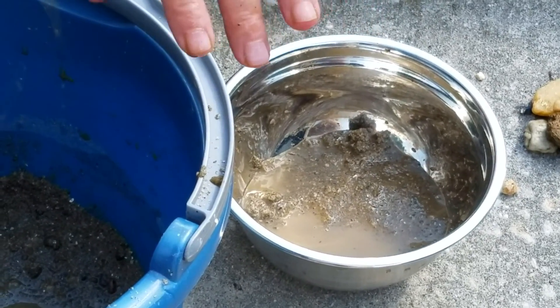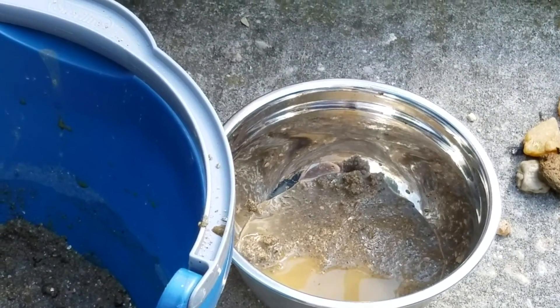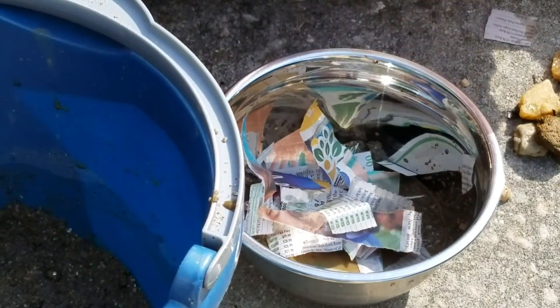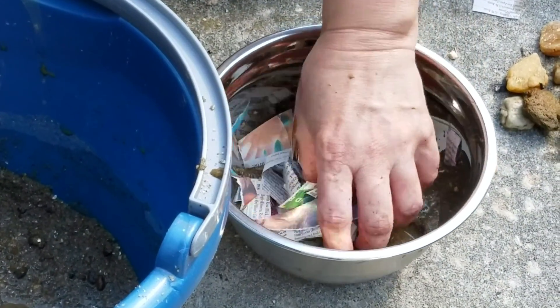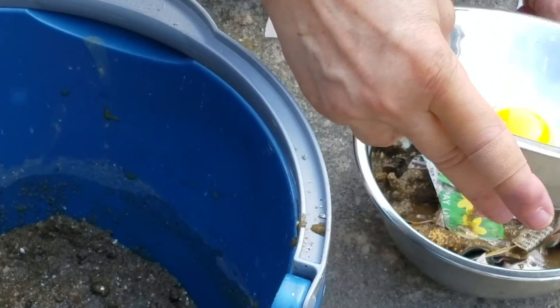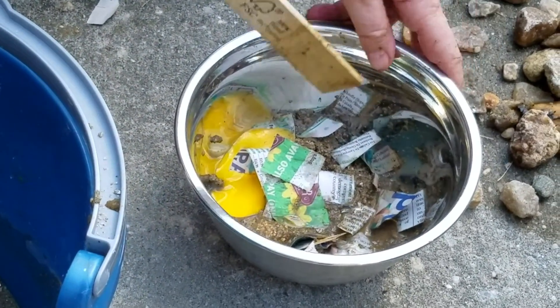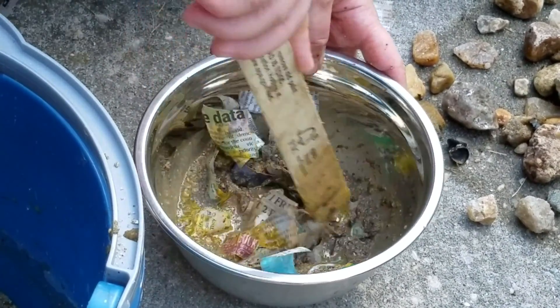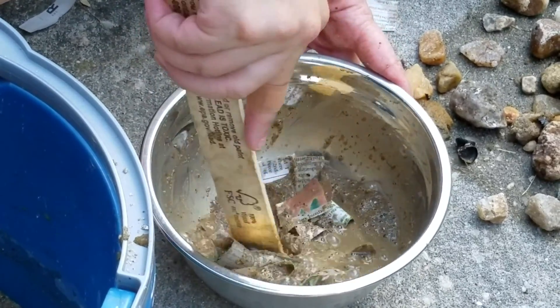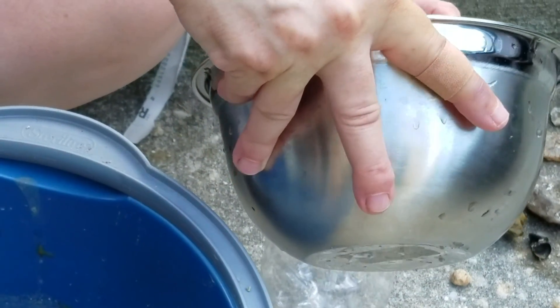I have some shredded newspaper — I've taken strips and cut them up into little bits, about a handful. That's going to act as our carbon source. And this egg yolk is going to be our sulfur source, so we're going to add that in as well and stir it all up so it's nicely mixed.